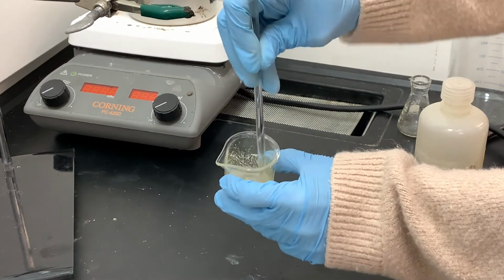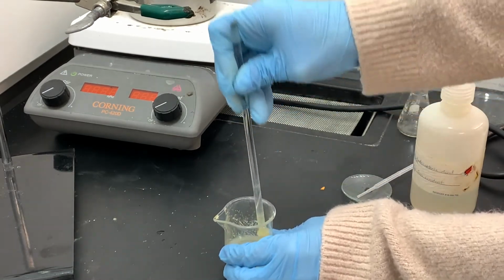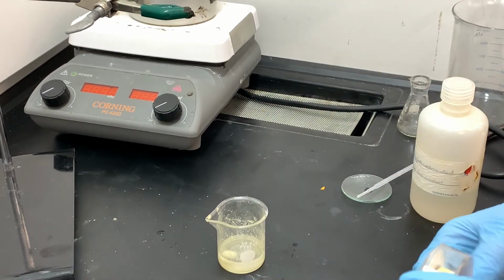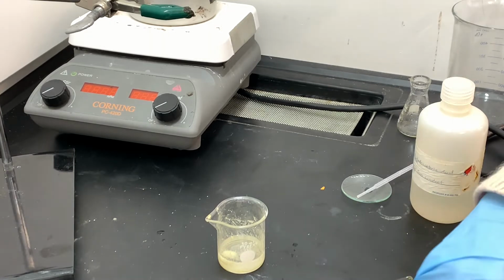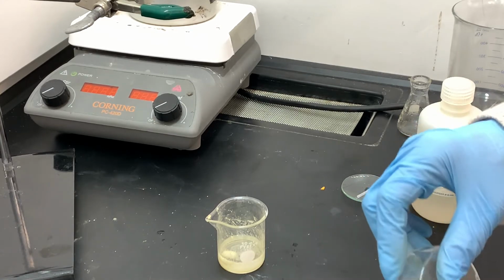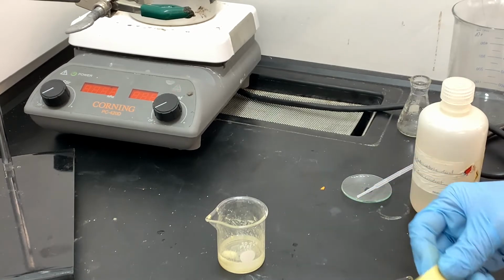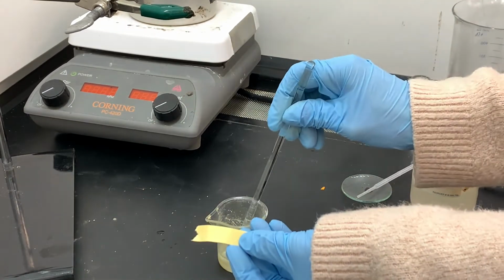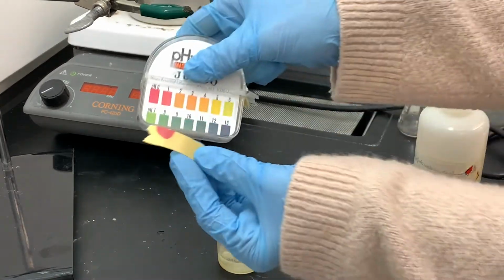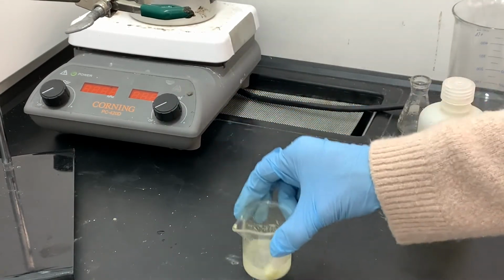To give this a chance to mix in and react. And then I'll do another pH check. I'm sure you can notice all of the yellow stuff that's sticking to that glass stir rod that I'm using. A lot of that is the product of this reaction. It's just stuck to the stirring rod, and it's also stuck a little bit to the inside of the beaker, which is going to make things really difficult in the filtering process. The pH looks really good, and so now I'm ready to move on to the next step, which is going to be to filter this.